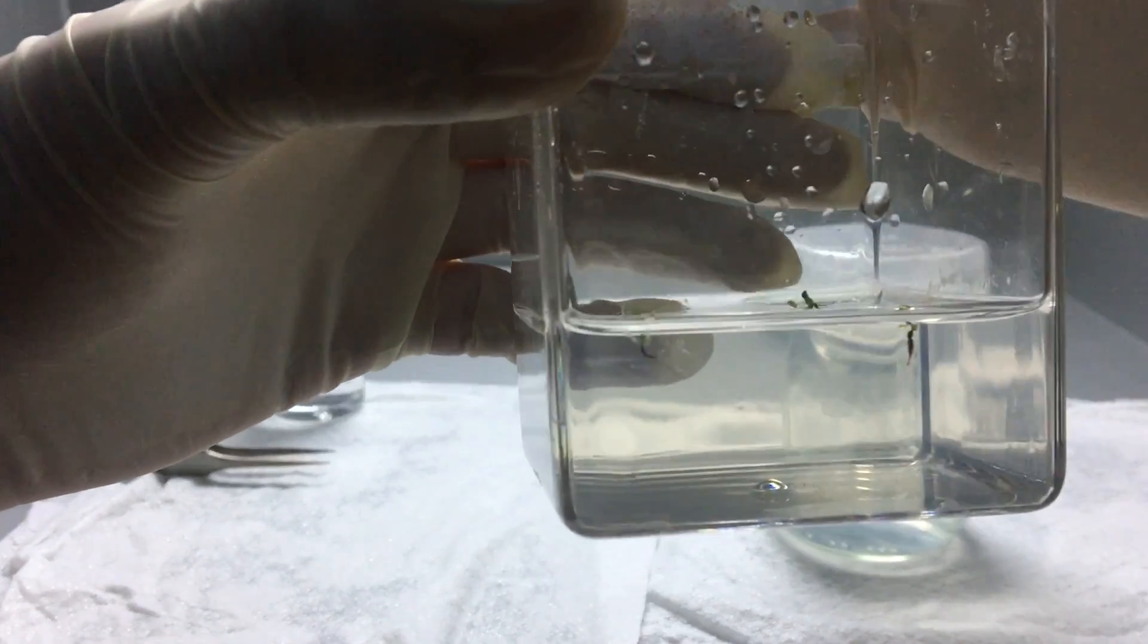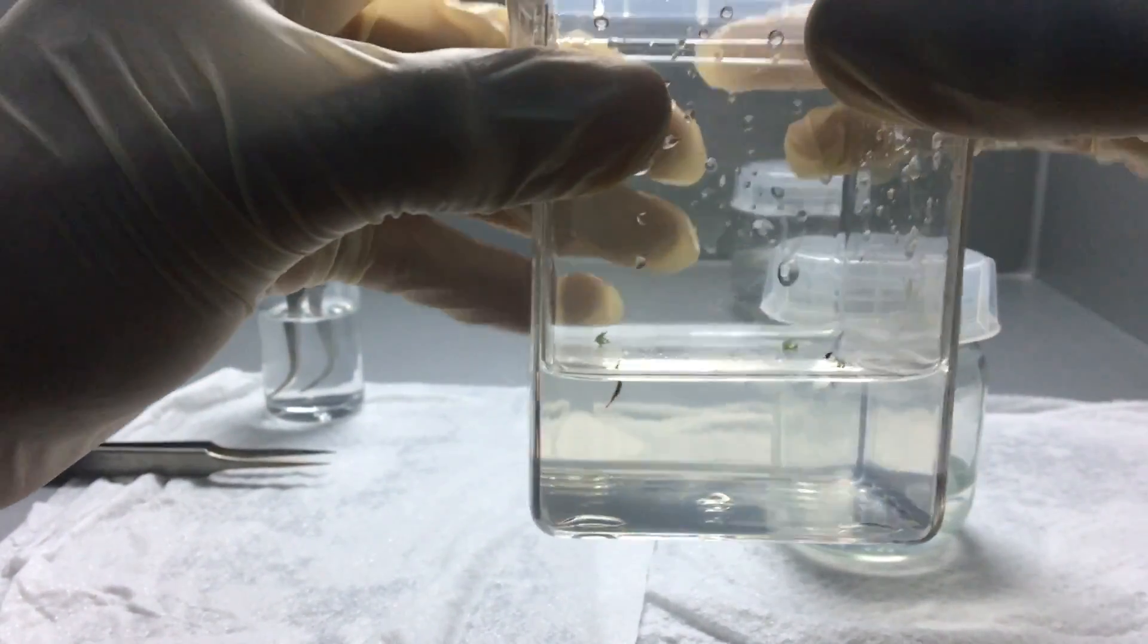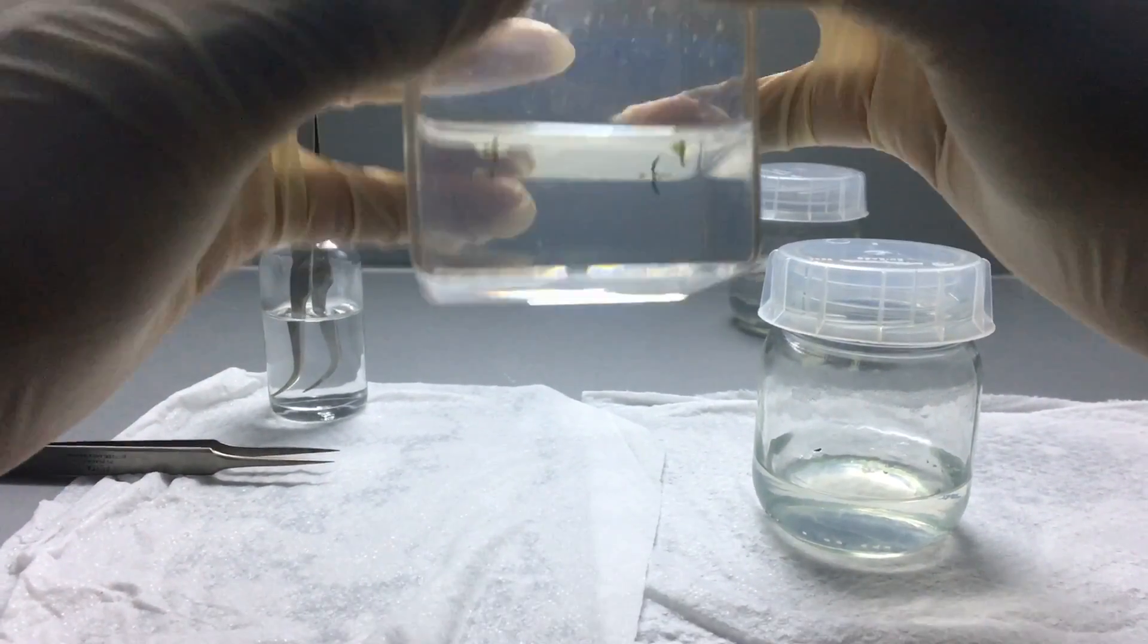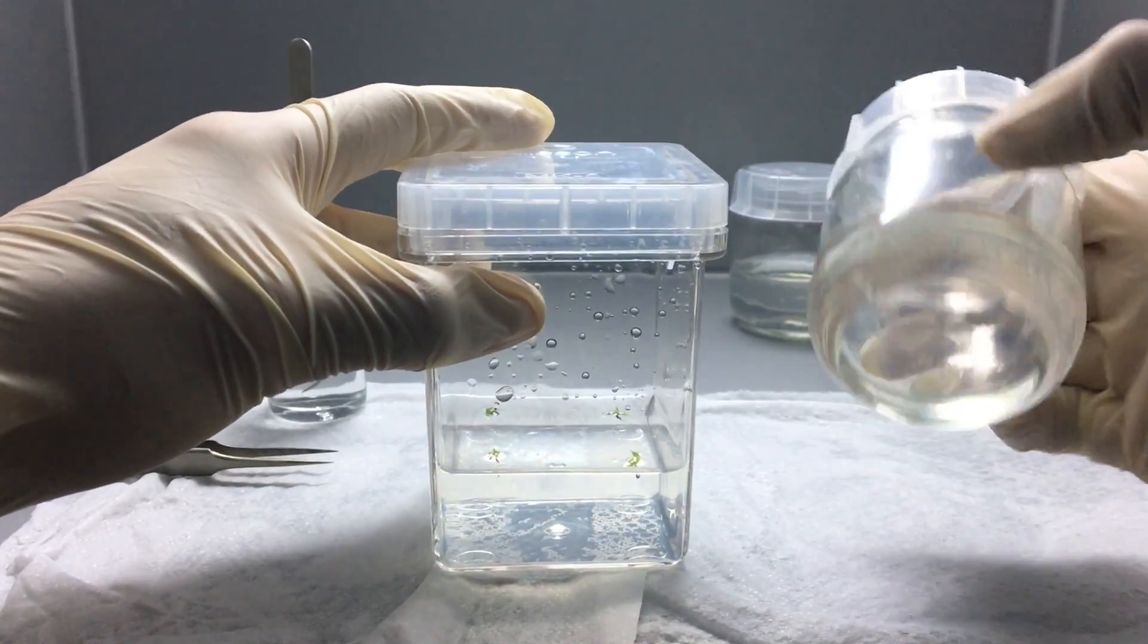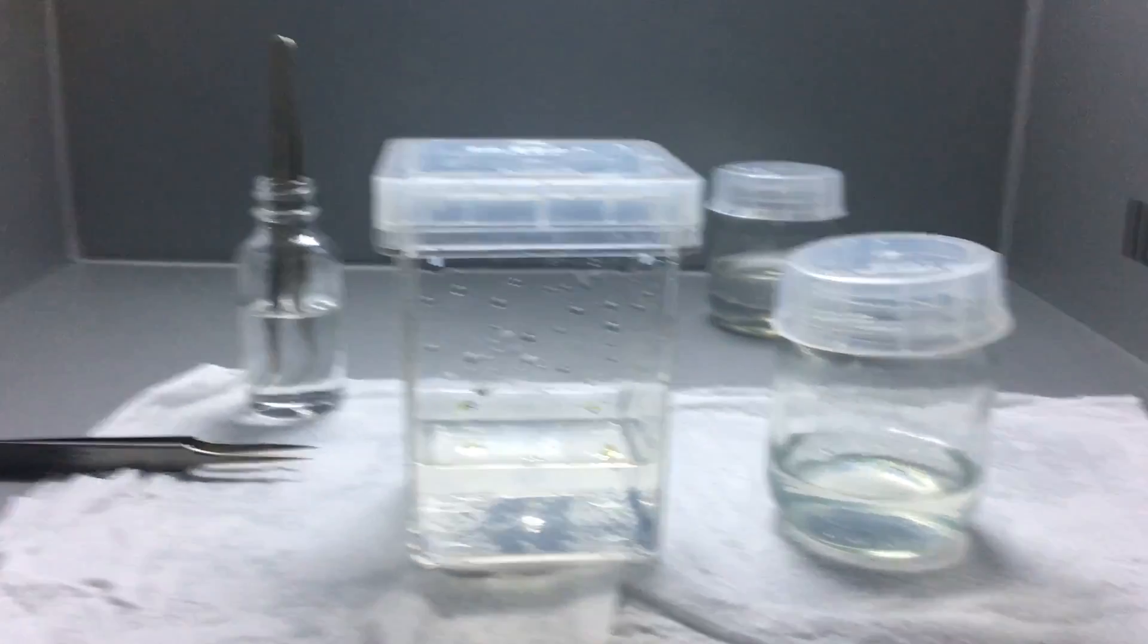Hopefully in a few weeks these guys will have multiplied in size and we'll be able to see what some of these traps look like. These seeds came from a very cool European cultivar that was selfed. So a lot of those offspring I've seen online have made some really cool traps or mutant babies, and I'm hoping some of these do the same.